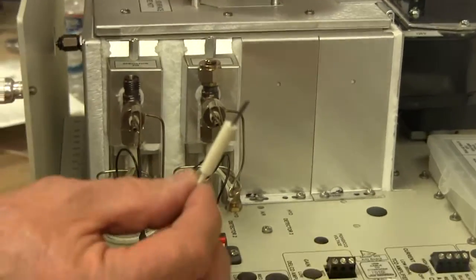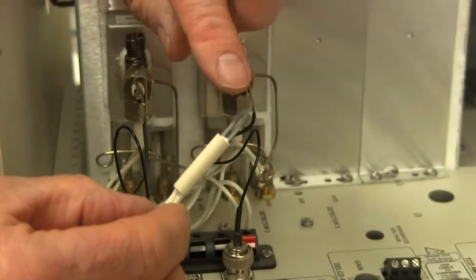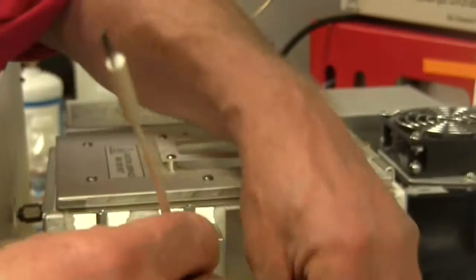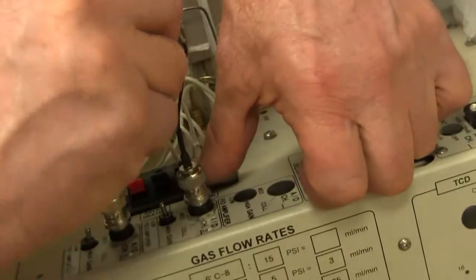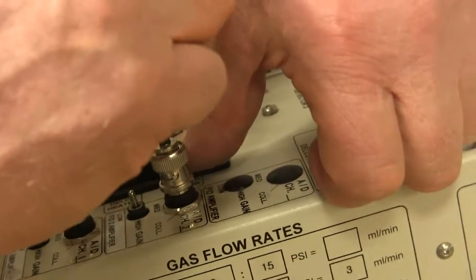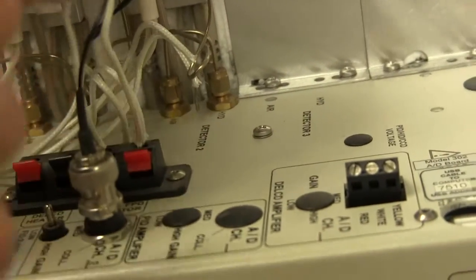This is what the igniter looks like. It's a silicon carbide igniter, and it glows red when it's connected to some source of voltage, which it gets by plugging it in right here underneath the FID detector. Wiggle that in there. Put that in there like so.